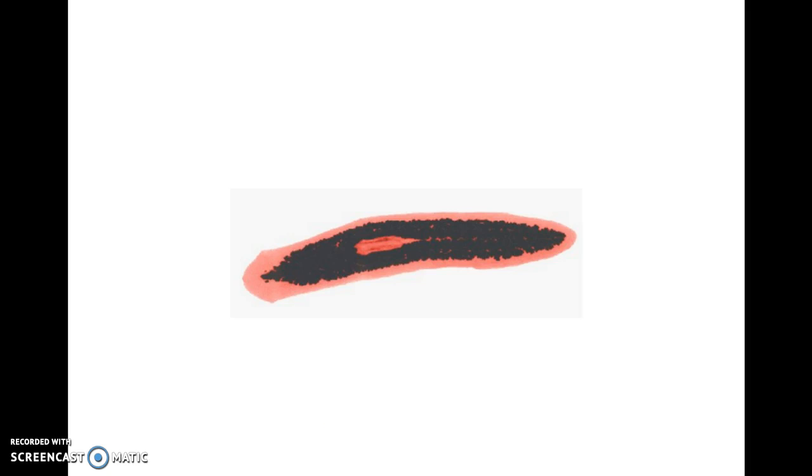Okay, the next slide that I want you to take a look at, this is actually an animal right here. This is a little creature called a planarian, and you might have learned about it last year. Maybe you do, maybe you don't remember. They're pretty small. They're related to worms. They're actually what's called a flatworm. The earthworm is a roundworm. This is a flatworm. They're small, and they're pretty primitive.